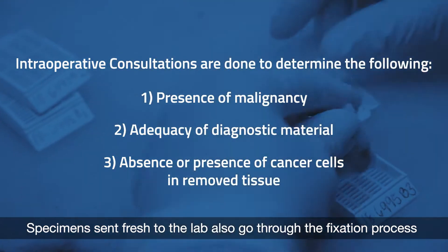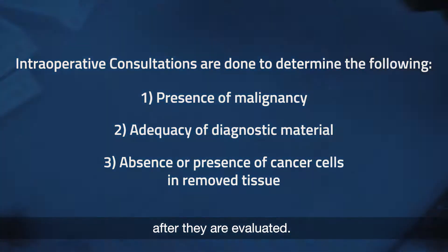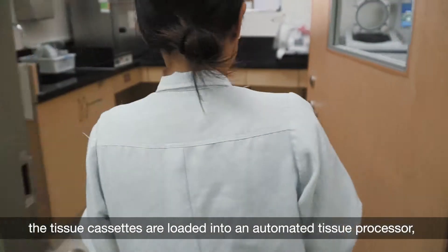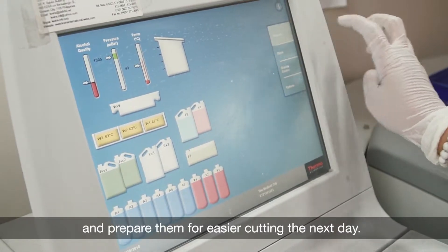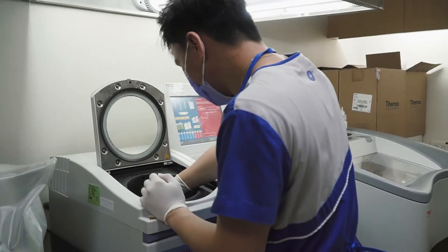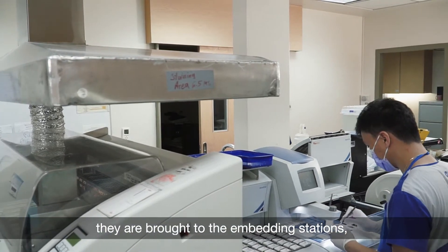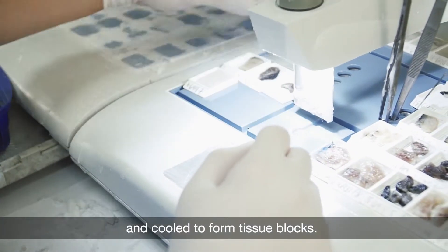Specimens sent fresh to the lab also go through the fixation process after they are evaluated. Following adequate fixation time, the tissue cassettes are loaded into an automated tissue processor, where several solutions dry them out overnight and prepare them for easier cutting the next day. After the tissues have been thoroughly dehydrated, they are brought to the embedding stations, where they are suspended in hot paraffin wax and cooled to form tissue blocks.